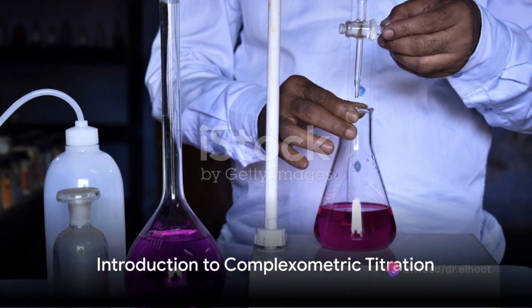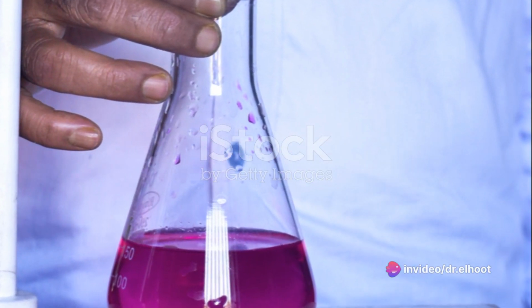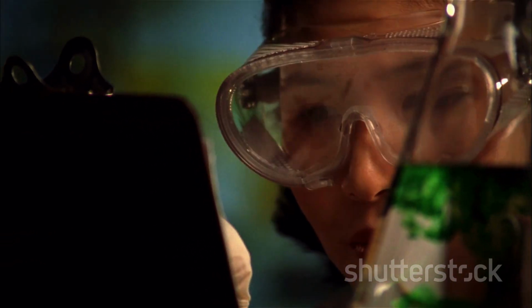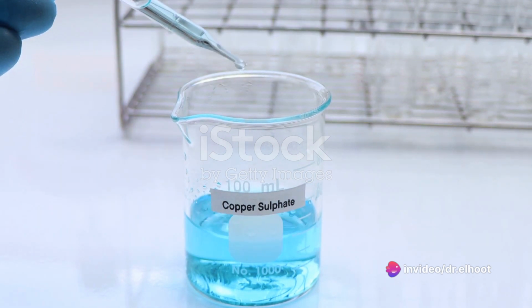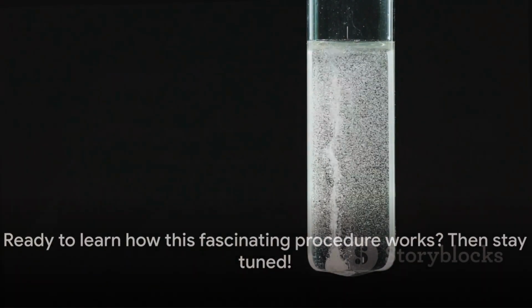Have you ever wondered how chemists determine the concentration of a metal ion in a solution? One of the methods they use is complexometric titration. This process involves a titrant, an analyte, and an indicator to measure precise quantities of metal ions. A classic example is the determination of zinc sulfate in Zinc Care® eye drops. Through this titration, chemists can accurately gauge the amount of zinc in the solution. Ready to learn how this fascinating procedure works?